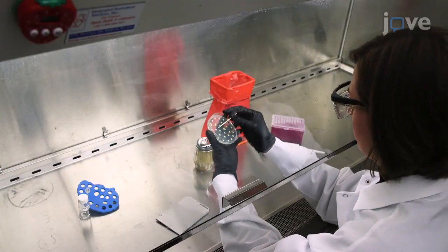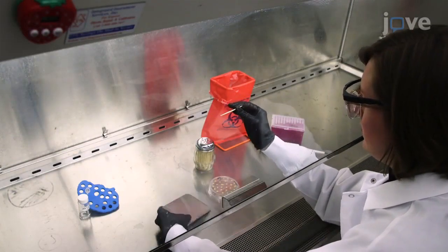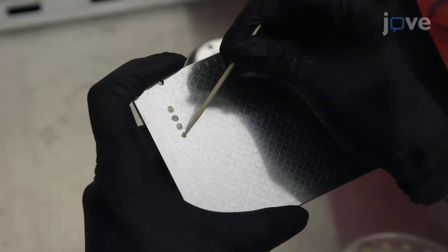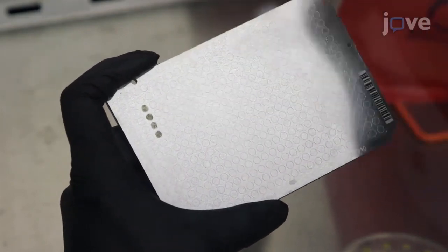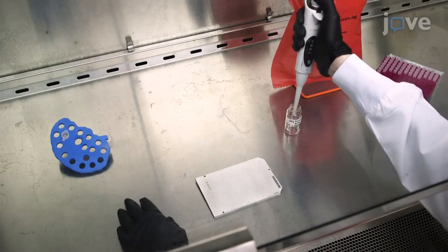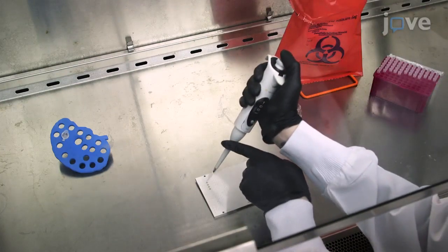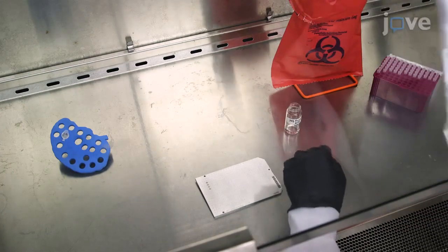Using a sterile toothpick, transfer a small portion of a bacterial colony to the appropriate spot on a clean MALDI plate. Spread the bacterial colony evenly over the spot so the spot appears as flat as possible. Overlay 1 microliter of 70% mass spectrometry-grade formic acid onto the sample and matrix control spots and allow the acid to air dry in a chemical fume hood.